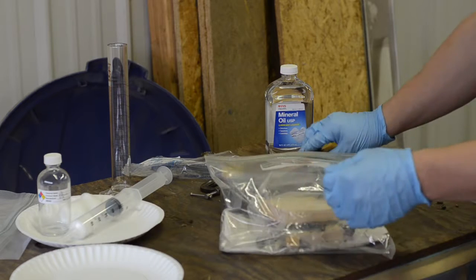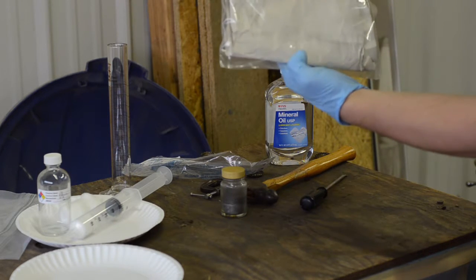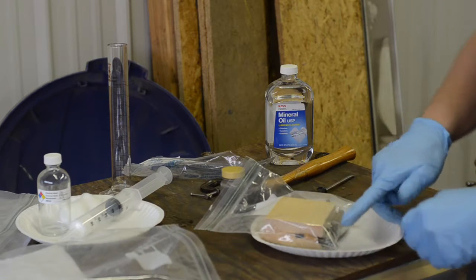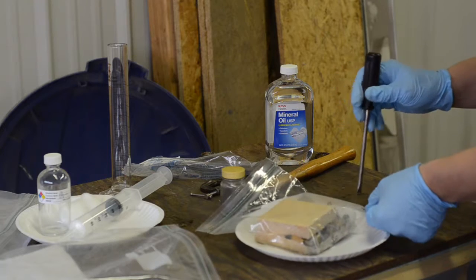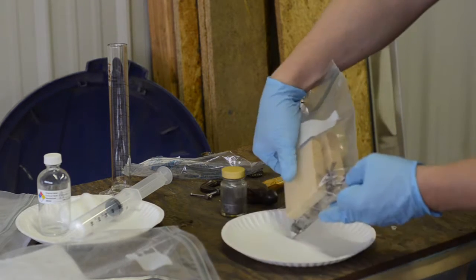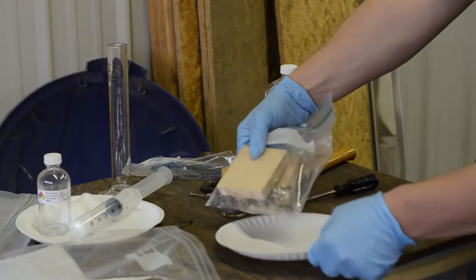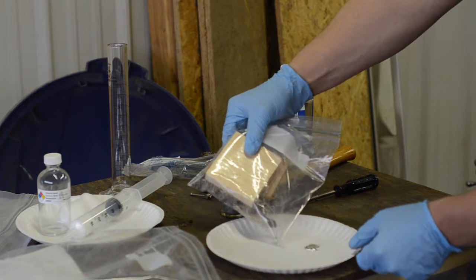Didn't want to give up. So now we have a bag of debris with mercury in the bottom. All right, so to get this mercury out, I'm going to slice open a small hole in the opposite corner of the bag, and then we're going to slowly pour the mercury out onto this paper plate.